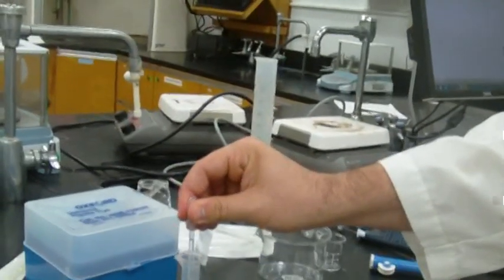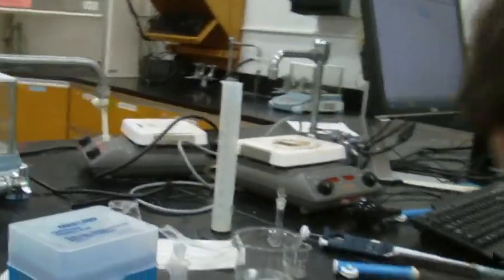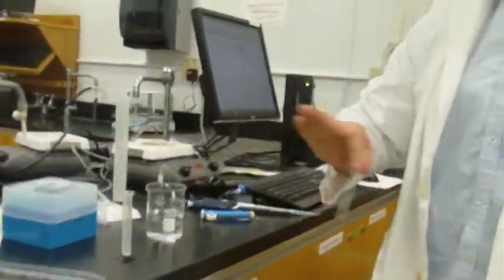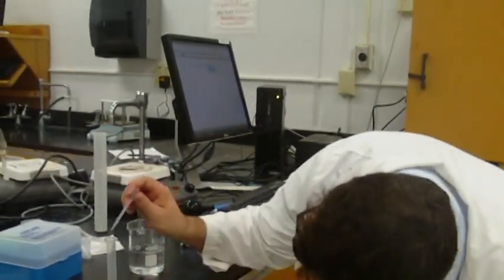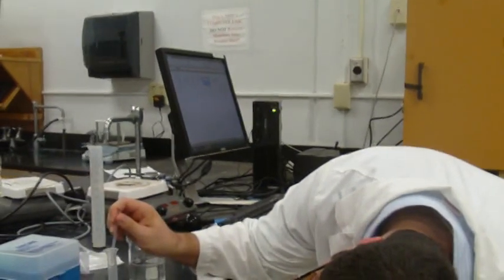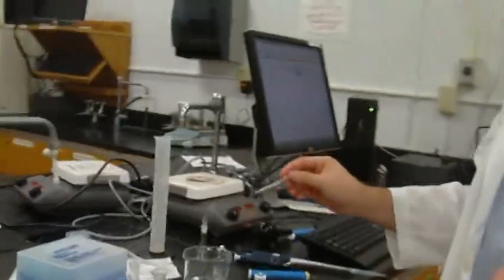So it's a little medicine dropper type thing, and you're going to fill it up. Then to see if we have the right volume, we get down at eye level, make sure we're looking at it perpendicular to the water level. And there we have a little less than we need, so a few more drops, until we got what we need.